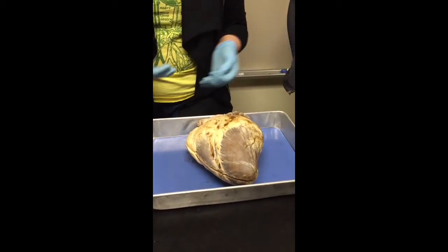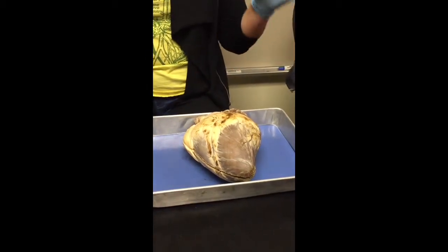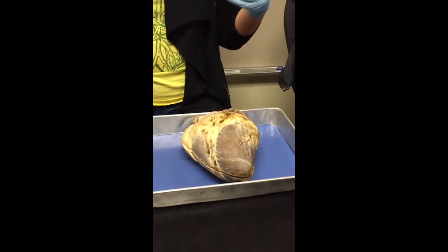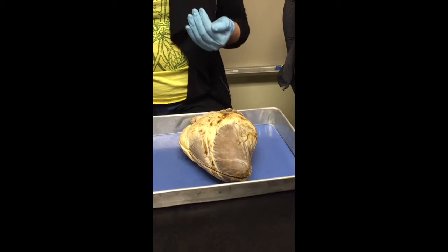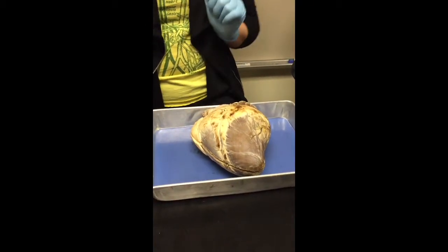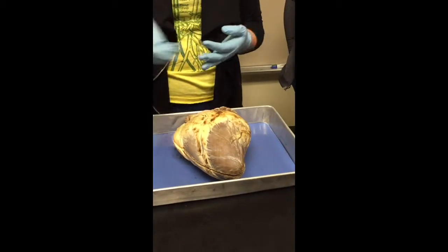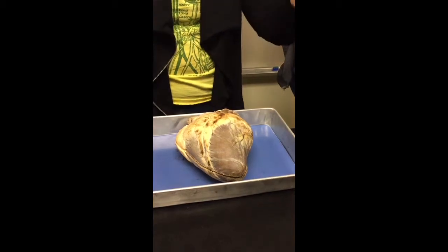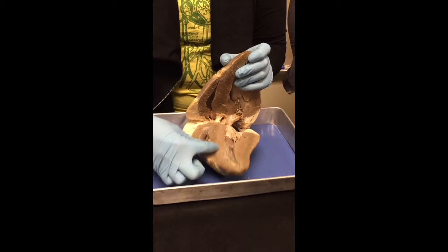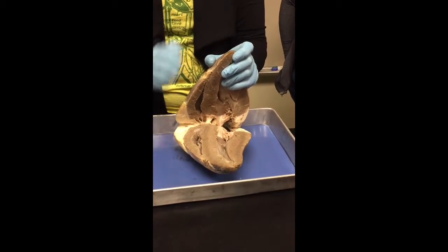To the lungs. So the right side of the heart deals with getting deoxygenated blood to the lungs to get reoxygenated. Where are the lungs located? Beside the heart. Lateral to the heart, right? So the lungs are located lateral to the heart, really close to it, right? So you don't need lots of force. You don't need lots of pressure behind the blood going to the lungs because the lungs are right there. So it makes sense that this side of the heart, the right side, is much thinner, much smaller than the left side because of where it's going.